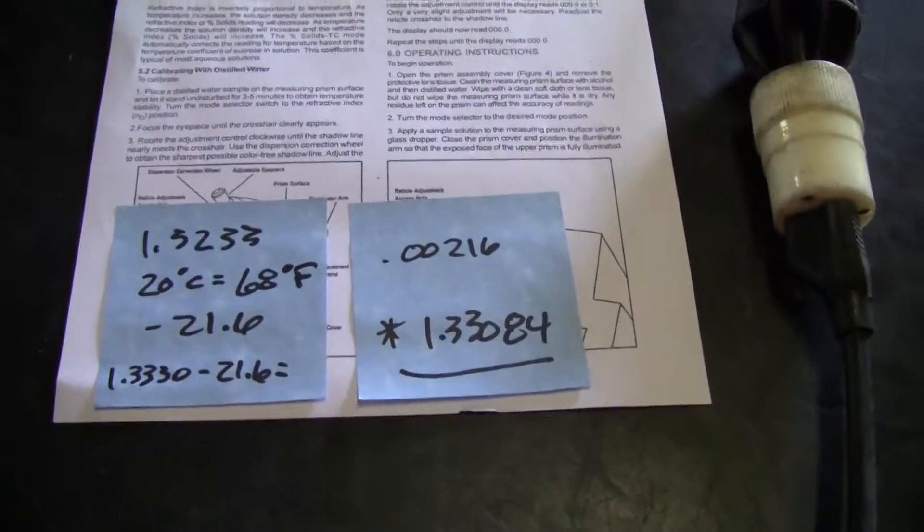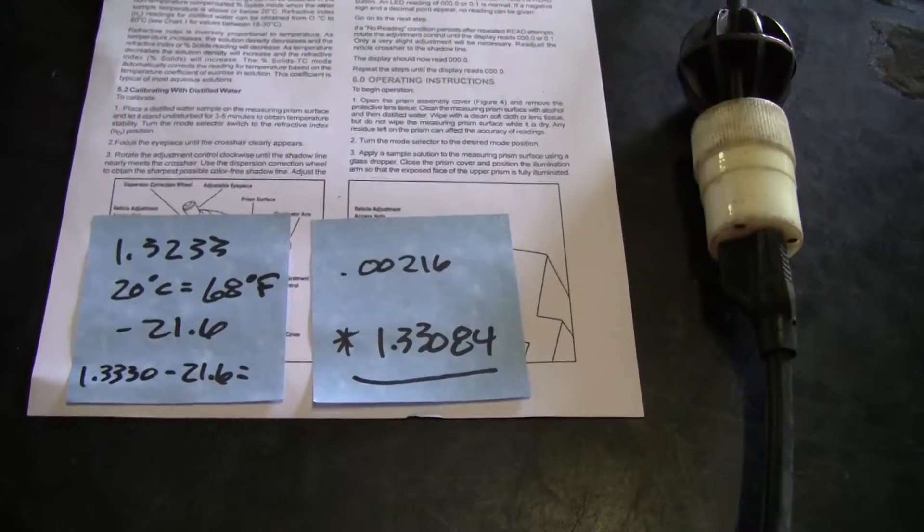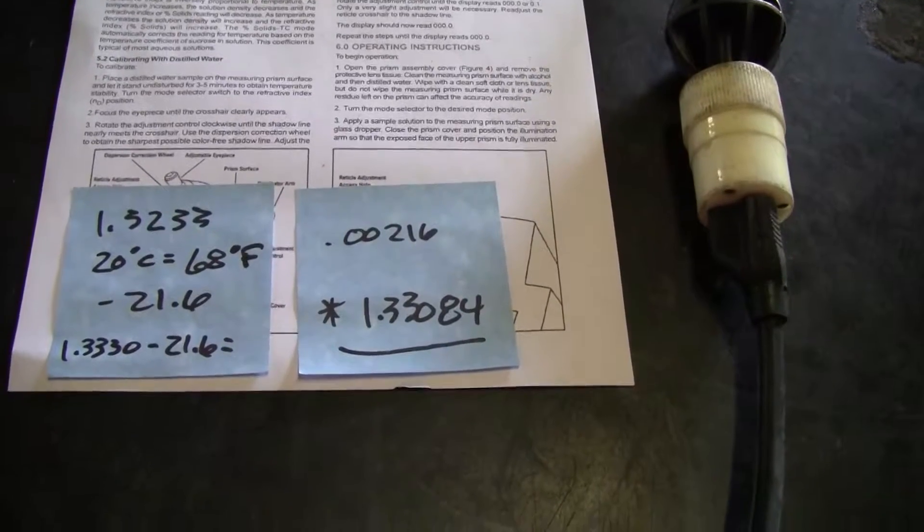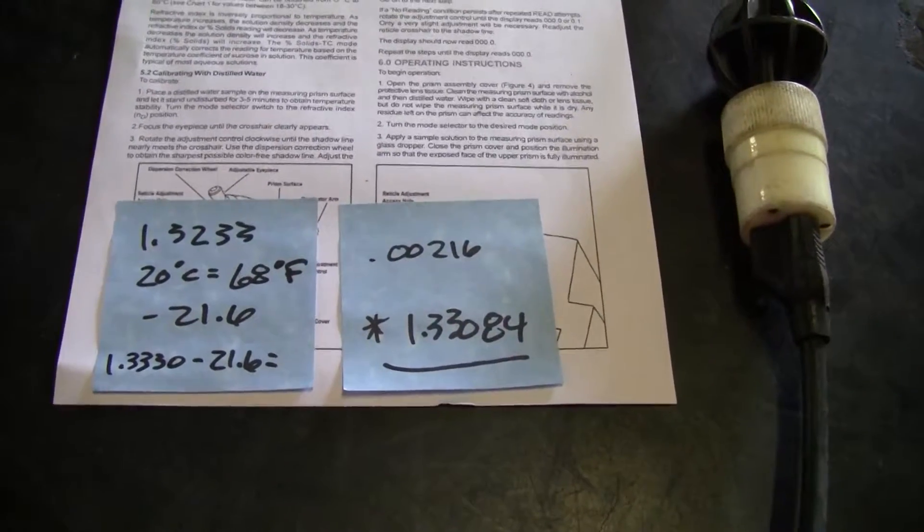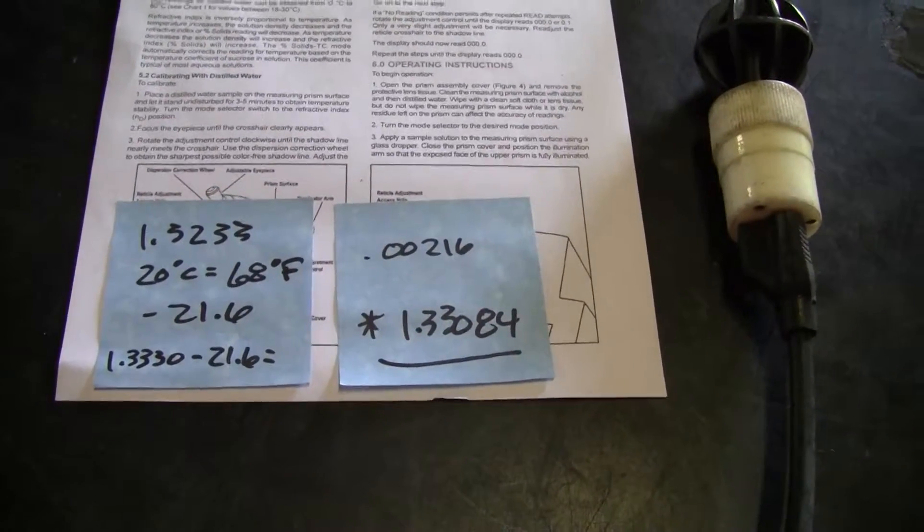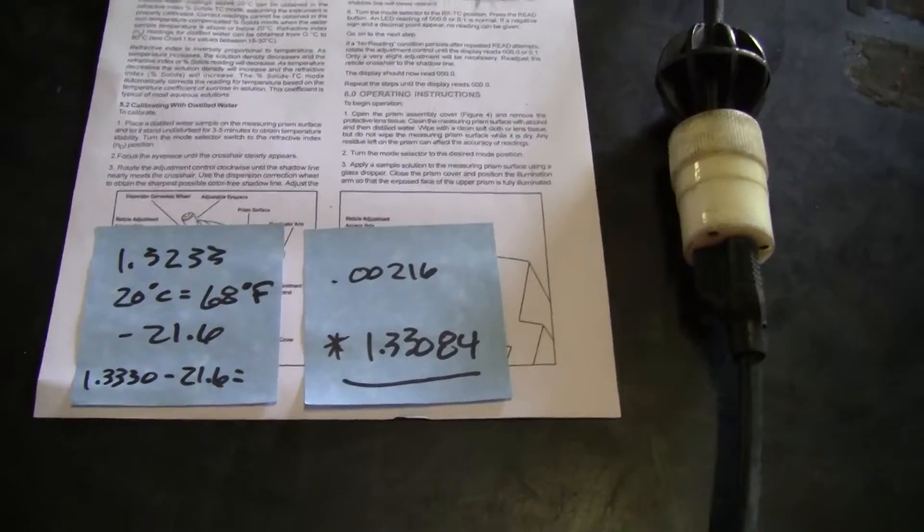We performed the standard calibration with distilled water and we've got some very positive results. It is extremely hot in the warehouse and that's why we have such a big temperature difference.